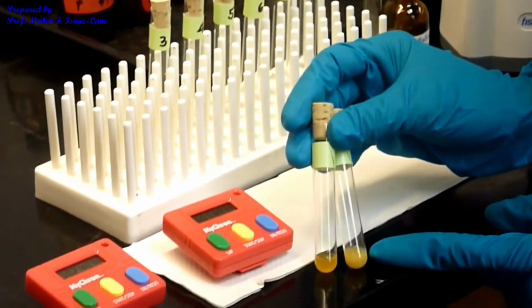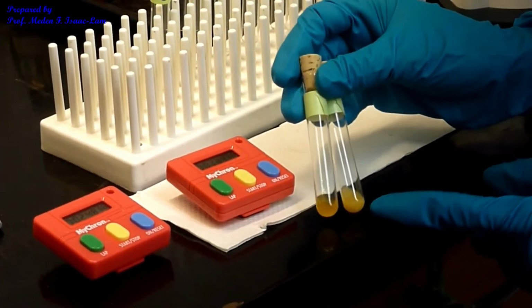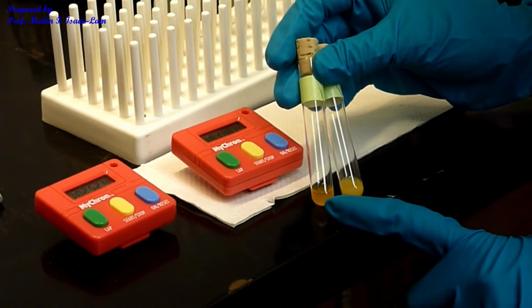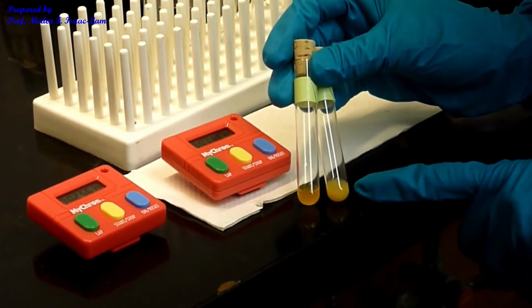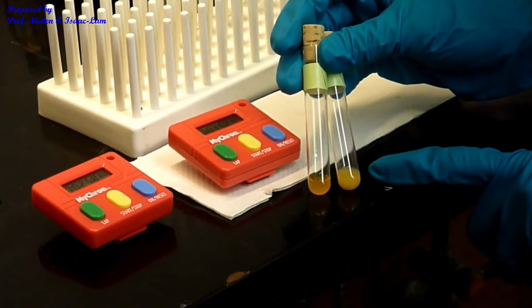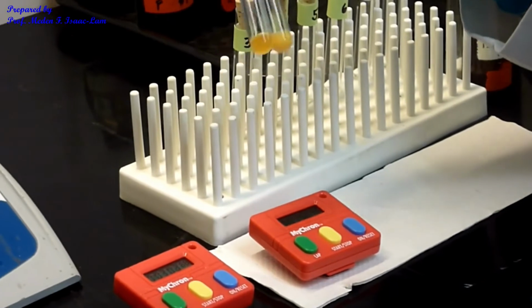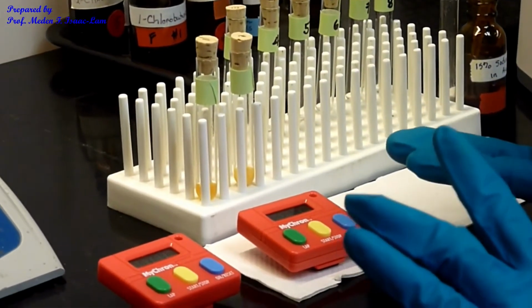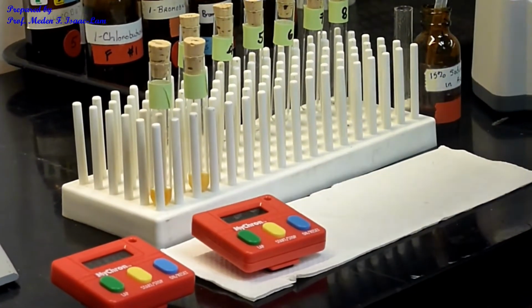So now I have more in here, so that's like 1 minute and 35 seconds. This one is reacting more. This one is reacting less. So this is almost 3 minutes. I saw this one at 1 minute and 35 seconds. So write that down, please, number 2. The maximum for the first part is going to be 5 minutes. If no precipitation after 5 minutes, we're going to stick it into the water bath.